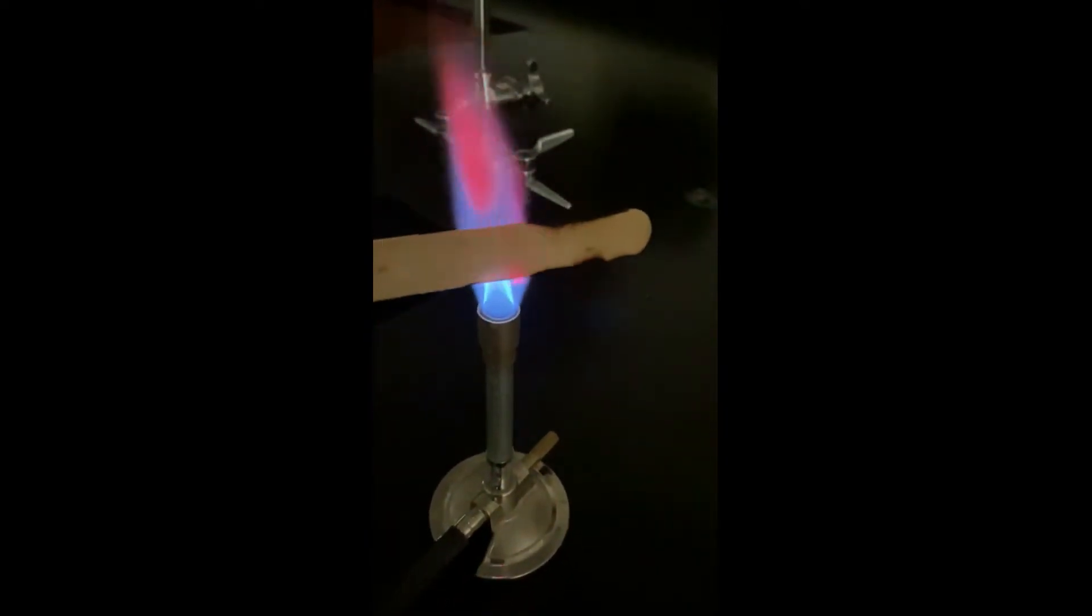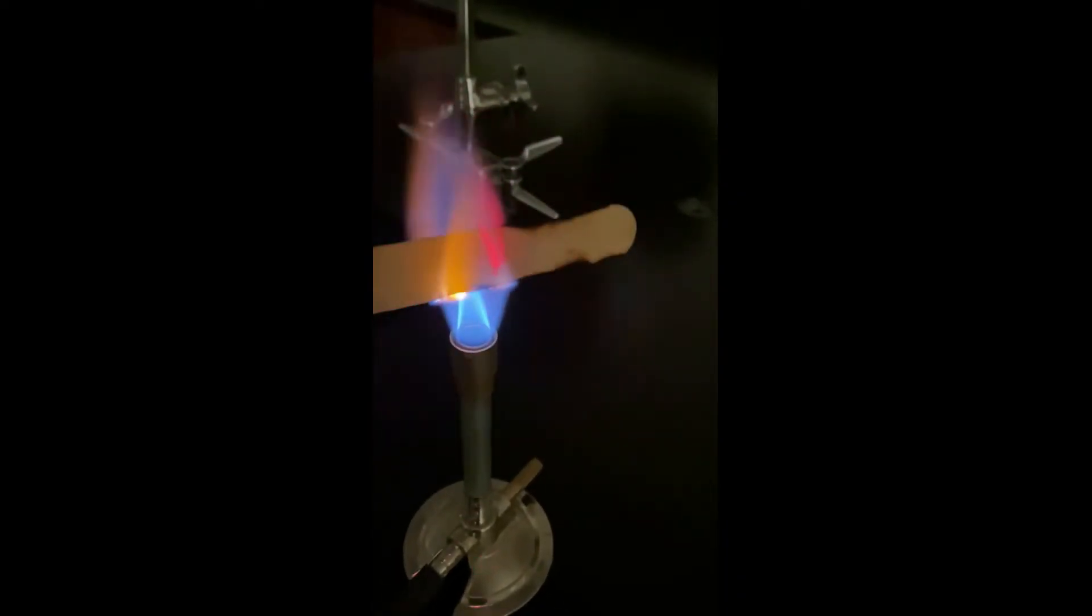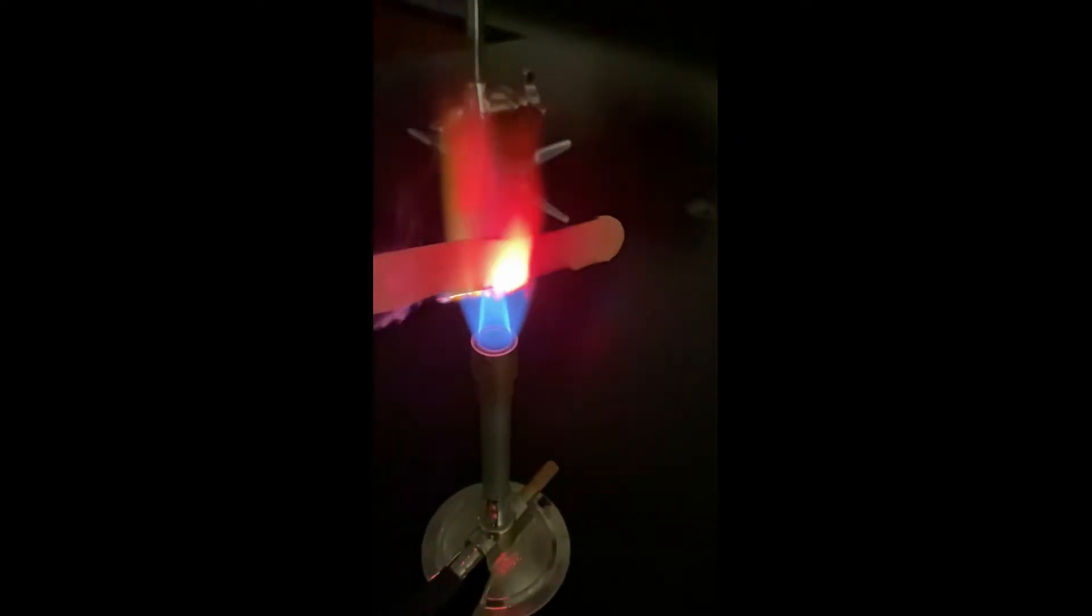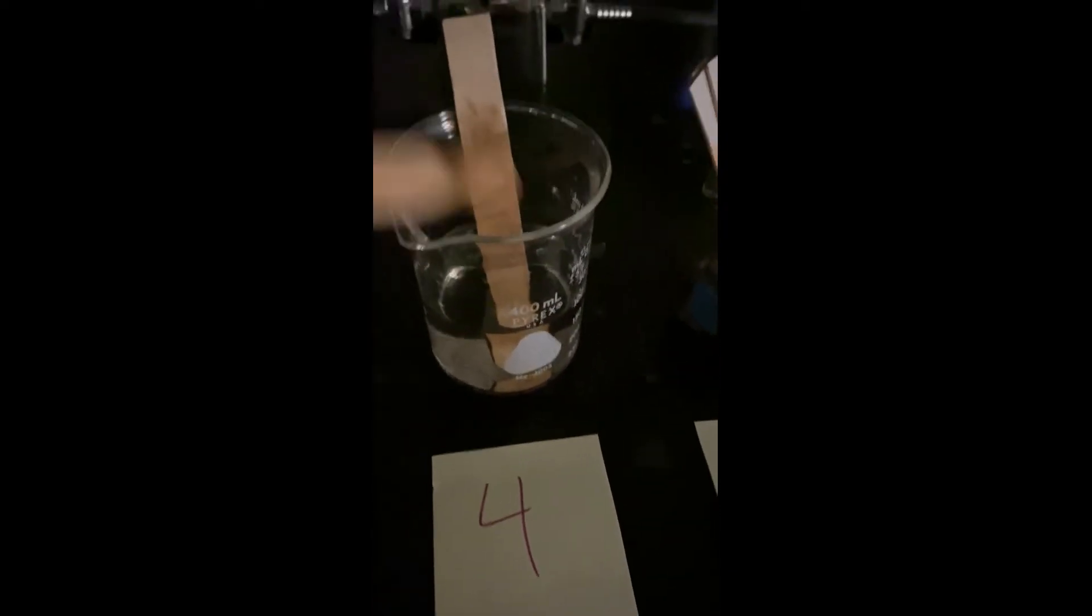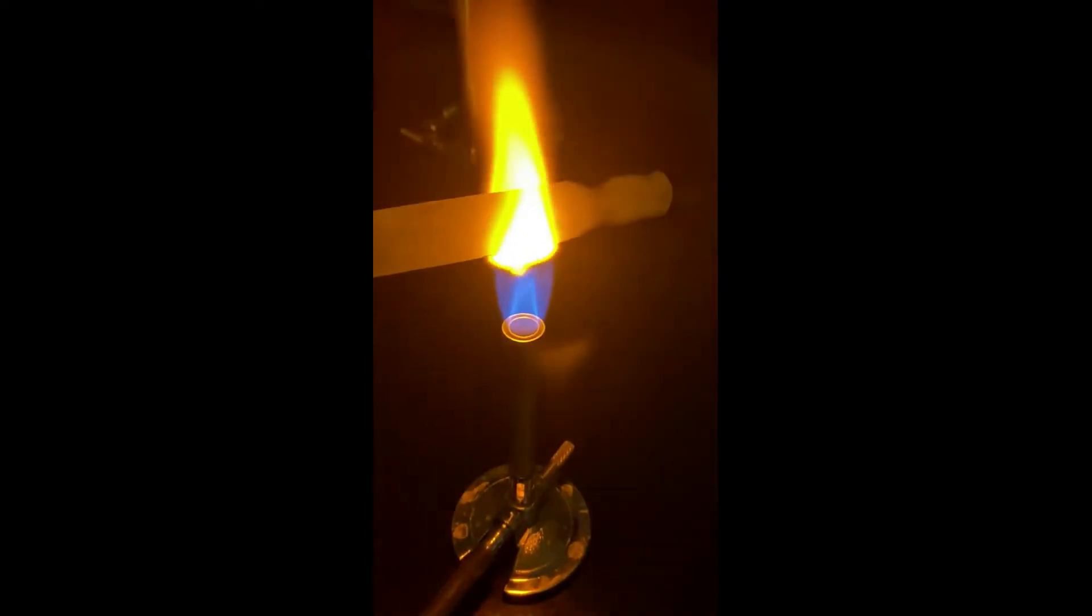Also, go ahead and turn off the lights. With the lights off, you can see the color shining through a lot more. And this one is about to conclude. And then we're going to go back and grab the next one, which is number four. Again, notice I'm tapping off each one as I do it.